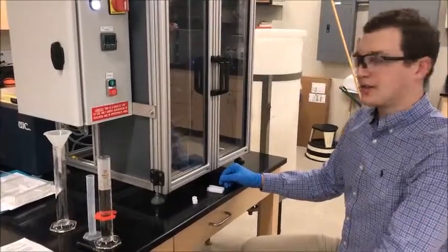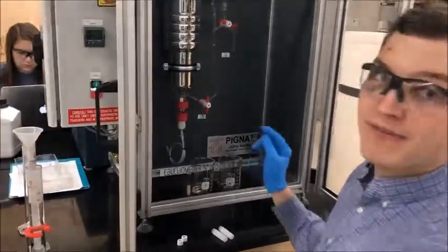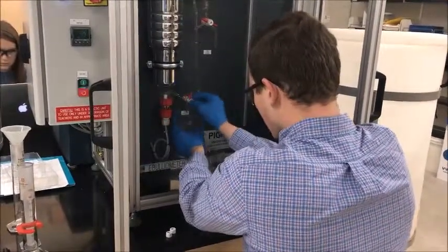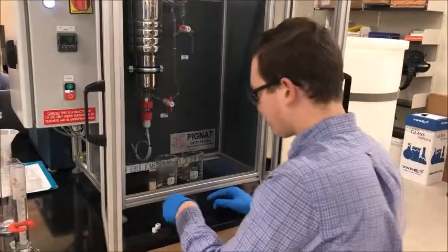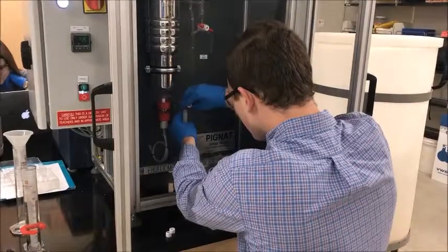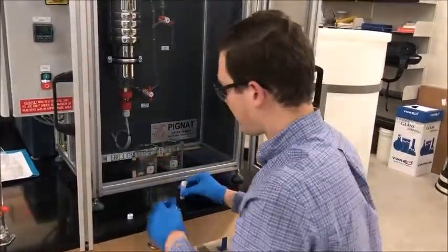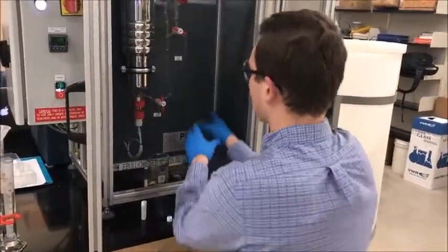When you're finally ready to take your samples, open the cabinet to the system, and then start by draining 15 milliliters out of each valve. Save this liquid as it will be recycled after the sample is taken. The reason we recycle that fluid through is to clear the line so we get a pure sample. We're going to do the same thing with the distillate.